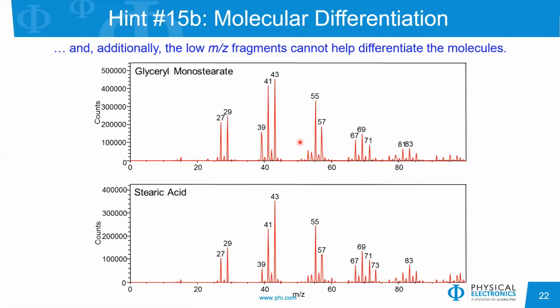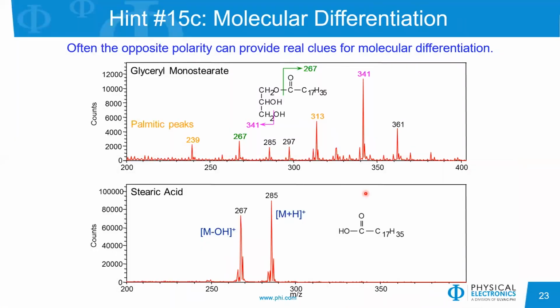So then we might look at the lower mass to charge ratio. So this again is the negative ion polarity. This is the positive ion polarity. And we see that at low mass to charge ratio, the peaks are very similar, and it would be very difficult to differentiate stearic acid from glycerol monostearate without using something like multivariate analysis. So let's look more closely at the data and see what else we can find.